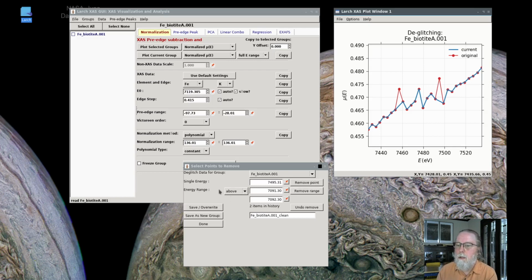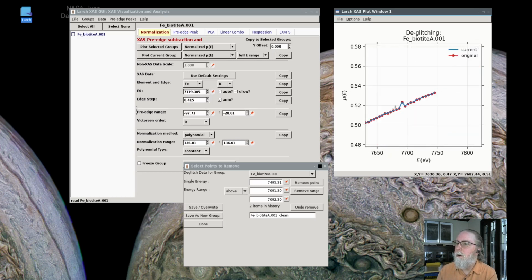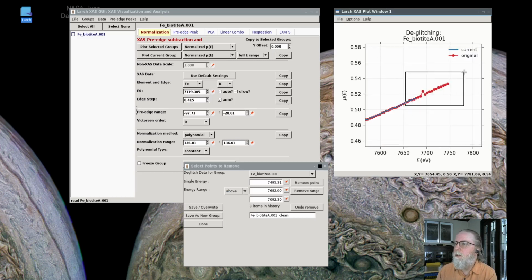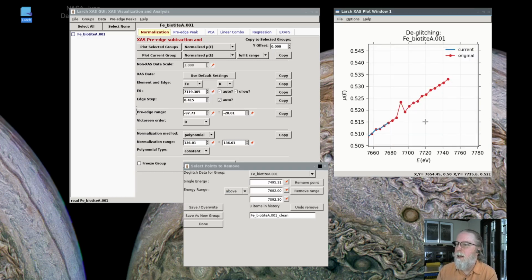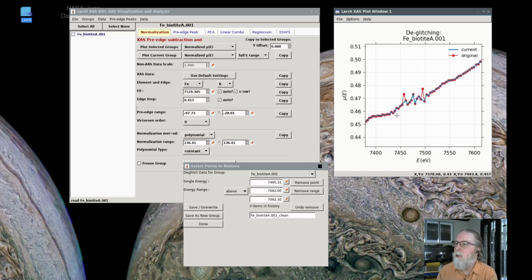So here we can select an energy range. We could select above, so that if we wanted to, say, select all of the data here and remove it. I could just say, let's take this point and say all of the data above this value, let's just remove all of that. And now the data set has no data above 7682.